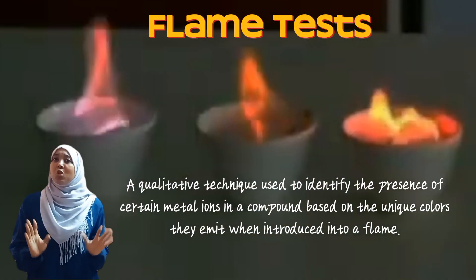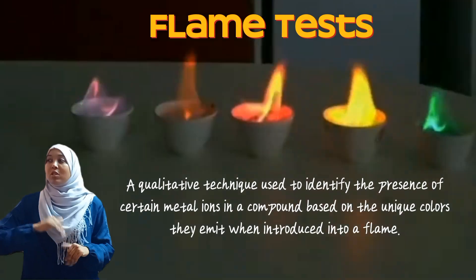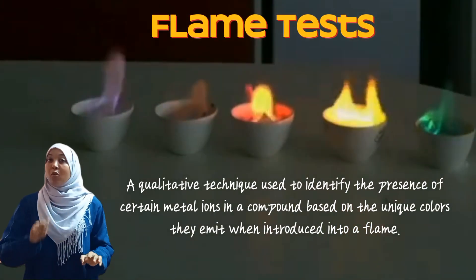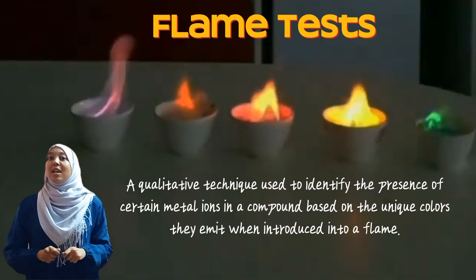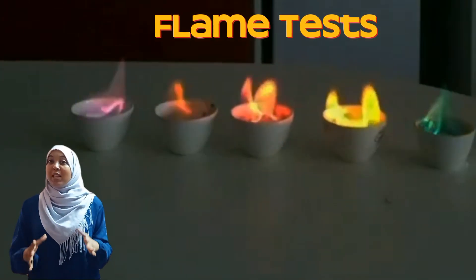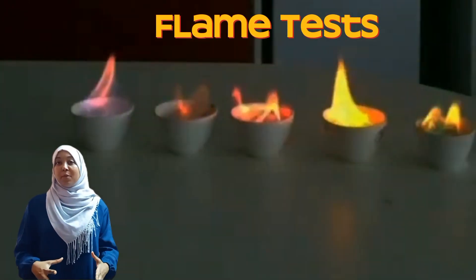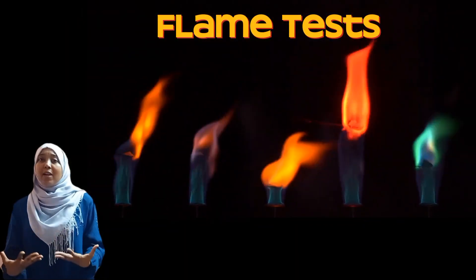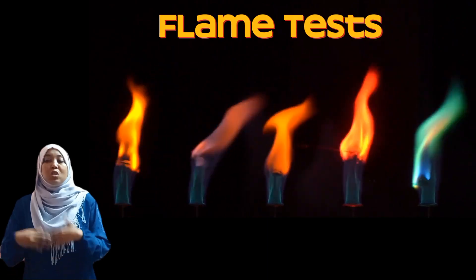Let's imagine you have a compound and you're not sure whether it contains sodium or potassium. You can take a sample of that compound and burn it. Depending on the color of the flame produced, you can know whether it contains sodium or potassium. The reason for this is because metal ions have distinctive flame colors.